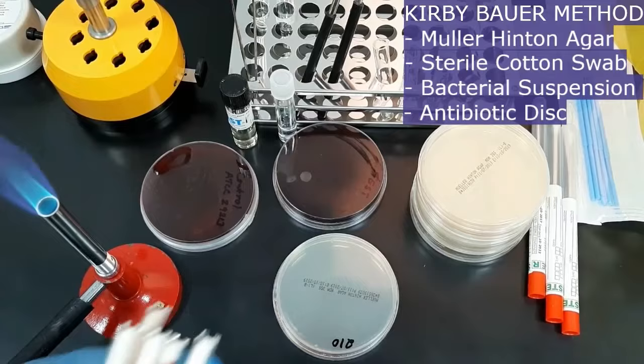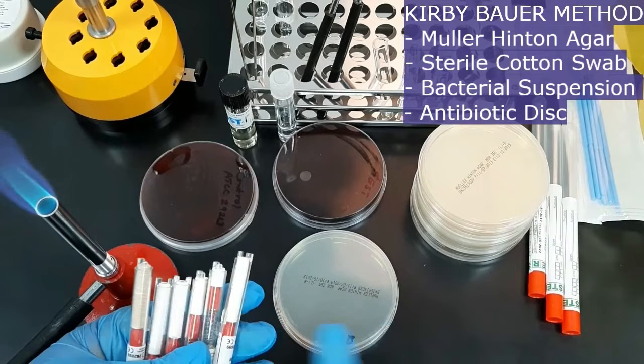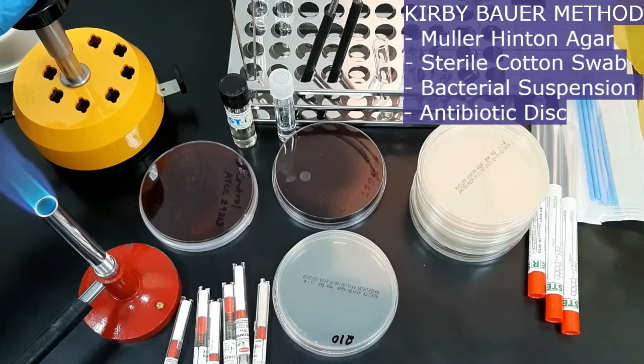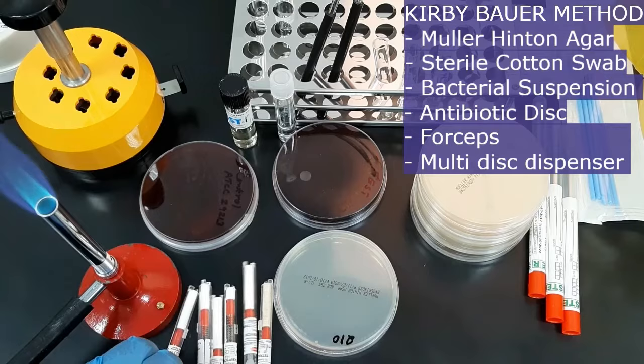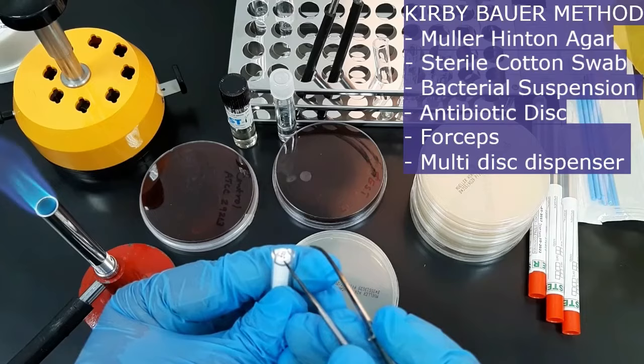The next step is to place the antibiotic disc onto the swabbed agar surface. First, select the antibiotics. You can transfer the disc with the help of forceps or use a multi-disc dispenser. Sterilize the tip of the forceps, pick up the disc carefully from the antibiotic set, and place the disc onto the swabbed agar surface.